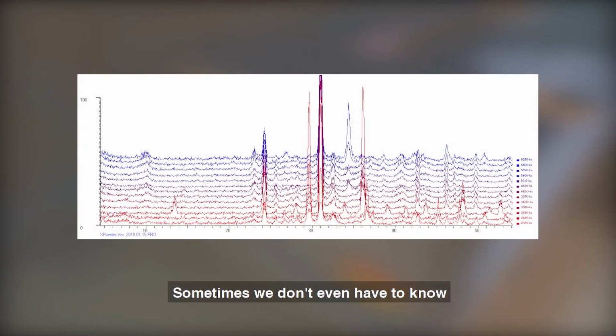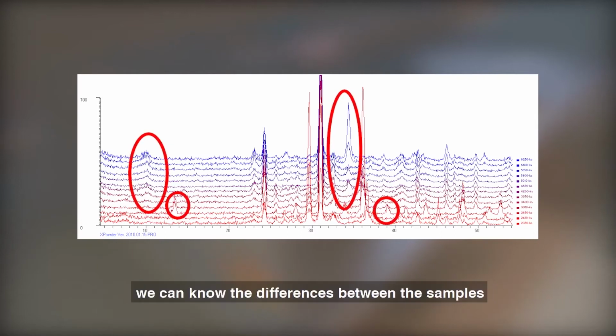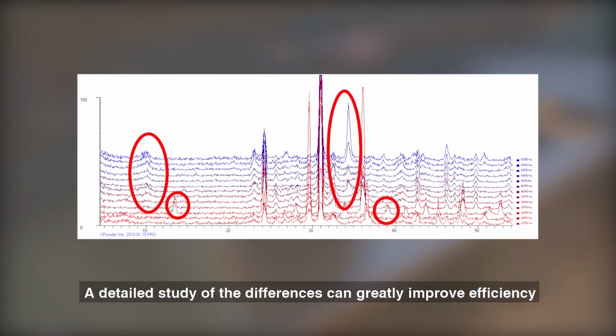Sometimes we don't even have to know the exact minerals in the formation. By comparing the XRD patterns in the pattern stack, we can know the differences between the samples. A detailed study of the differences can greatly improve efficiency.